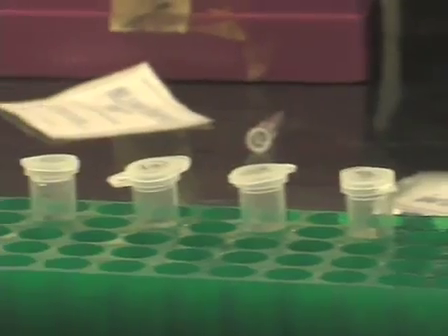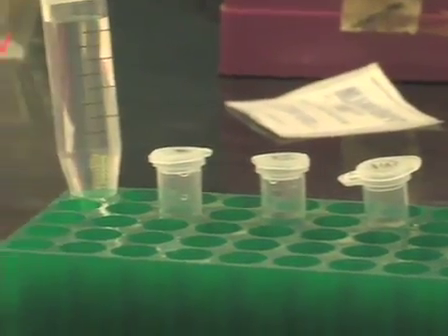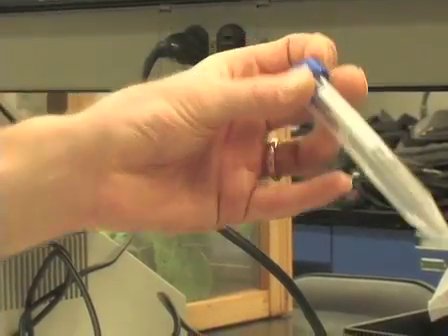Now it's time to prepare the experimental diet. I have here a solution of sucrose and 20 amino acids. Aphids can survive and reproduce normally on this diet for at least a week. Now I've aliquoted this diet in one milliliter aliquots containing varying concentrations of nicotine from zero to 500 micromolar in these eppendorf tubes.